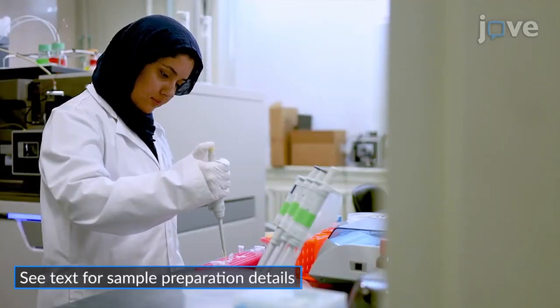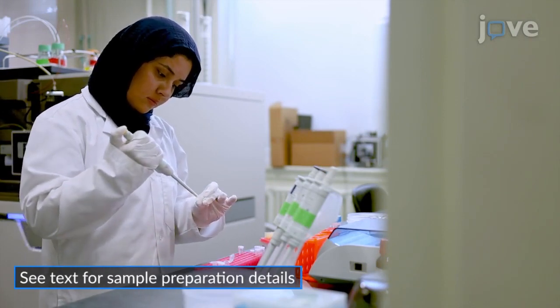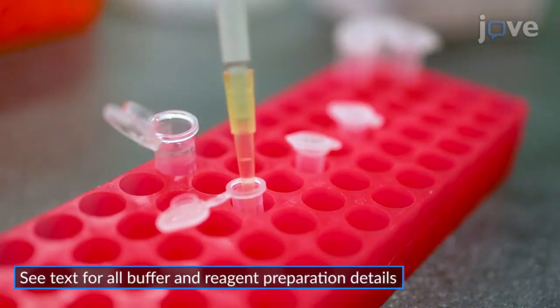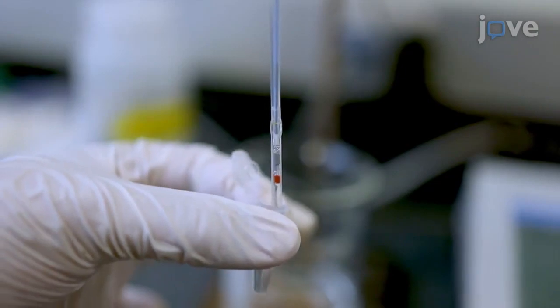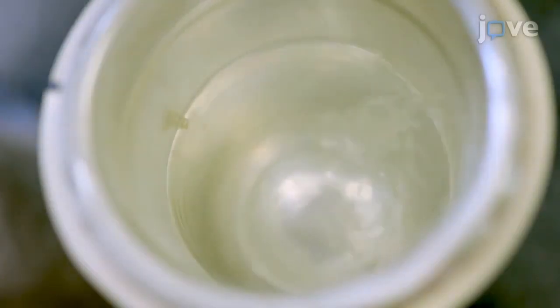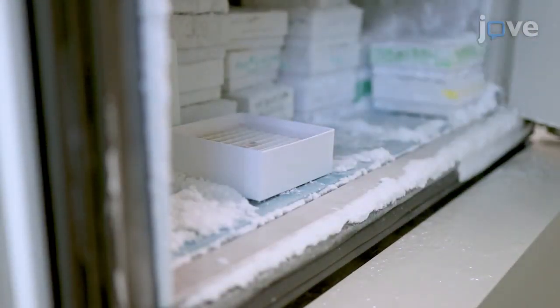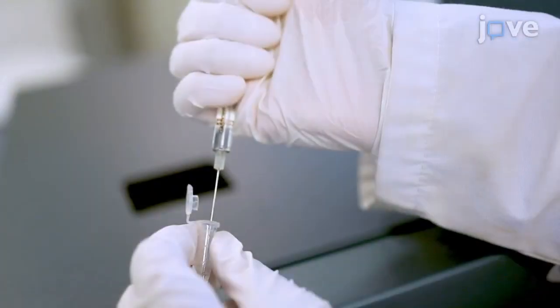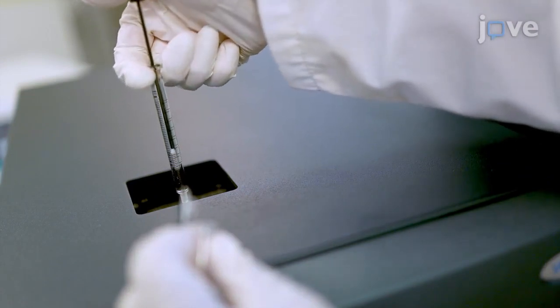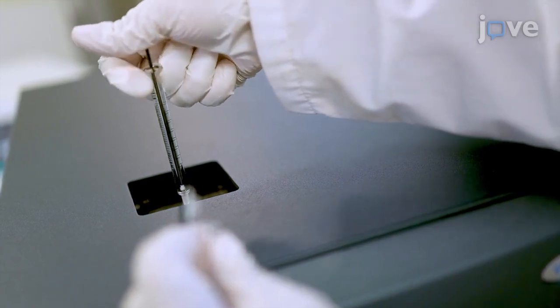Begin by preparing undeuterated reference samples for the protein of interest in triplicate in 500 microliter tubes. Quench the samples with the appropriate volume of quench buffer per tube to achieve a pH meter reading of 2.5. Flash freeze the samples in liquid nitrogen for storage at -80 degrees Celsius until their analysis. Then analyze the protiated enzyme reference samples using a bottom-up liquid chromatography mass spectrometry workflow according to standard protocols.